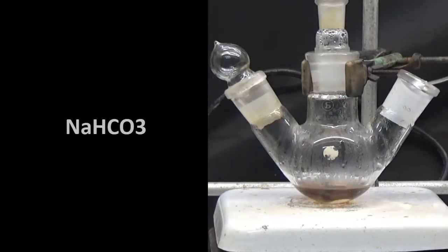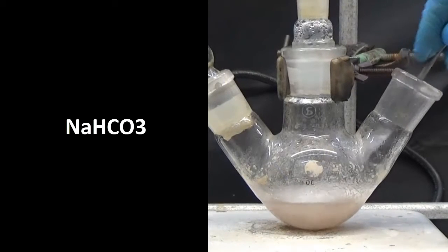Let cool a little and add small portions of sodium hydrogen carbonate until you reach a pH between 6 and 6.5.